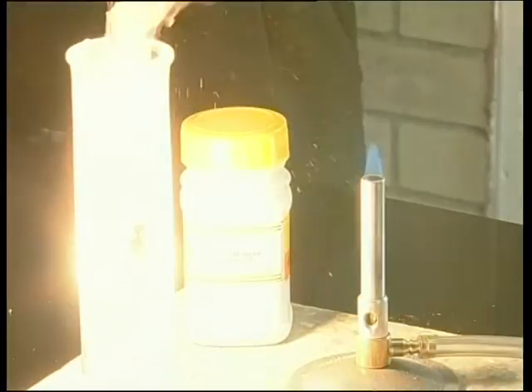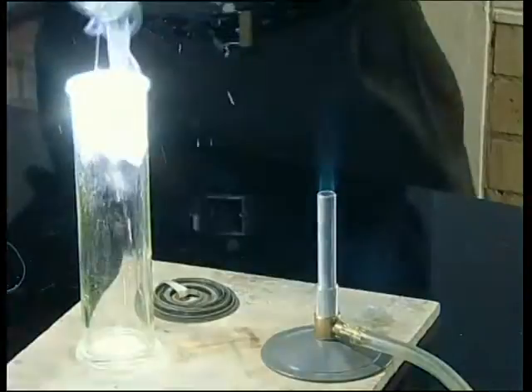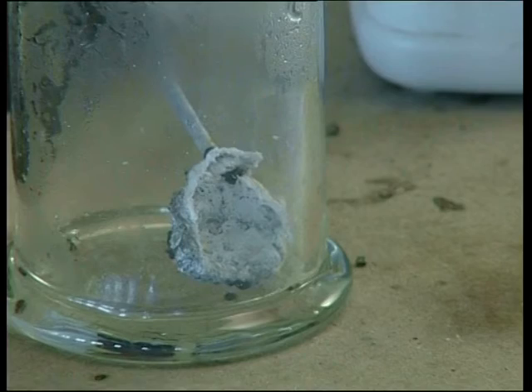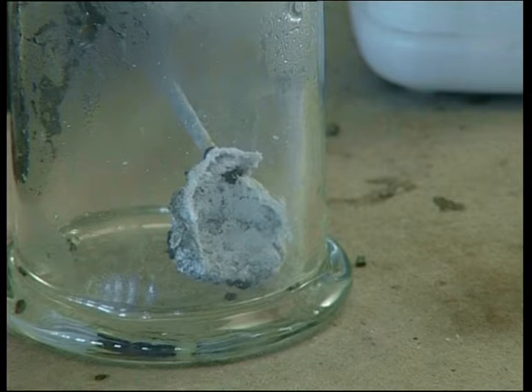Hi, my name is Diyashur. In our previous lesson, we started to look at the reactions of the alkaline earth metals by burning magnesium and calcium in pure oxygen. We observed that both these substances burned with a distinctive color flame. We also saw white alkaline earth metal oxide forming with each of the reactions. In today's lesson, we will be focusing on the reaction of the metal oxides in water.